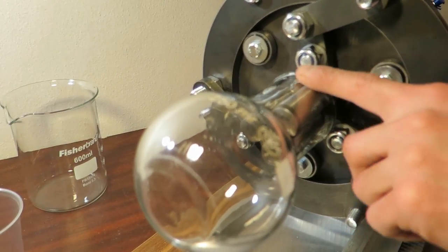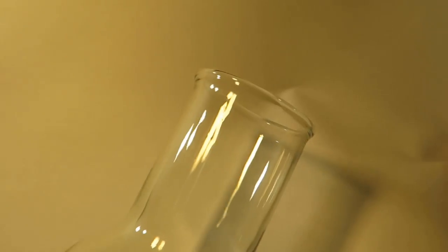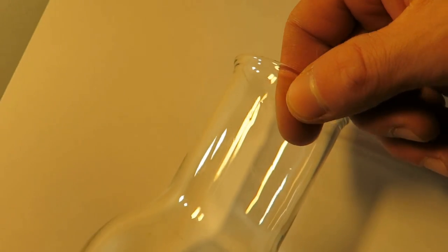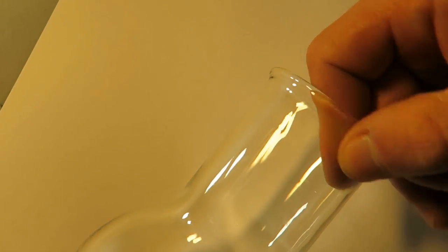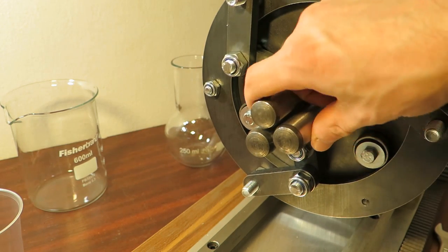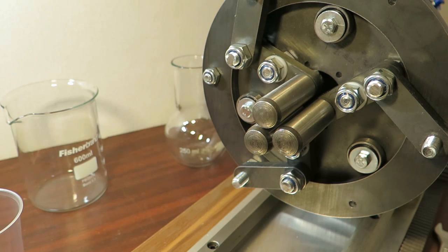Wow, I can see that it was twisted right there. Can you see it? You can see it right there. It's like twisted. You see? Right there. Impressive. And that's why you want to have synchronized spindles, because if one is turning a little bit faster than the second one, it will twist the glass basically.